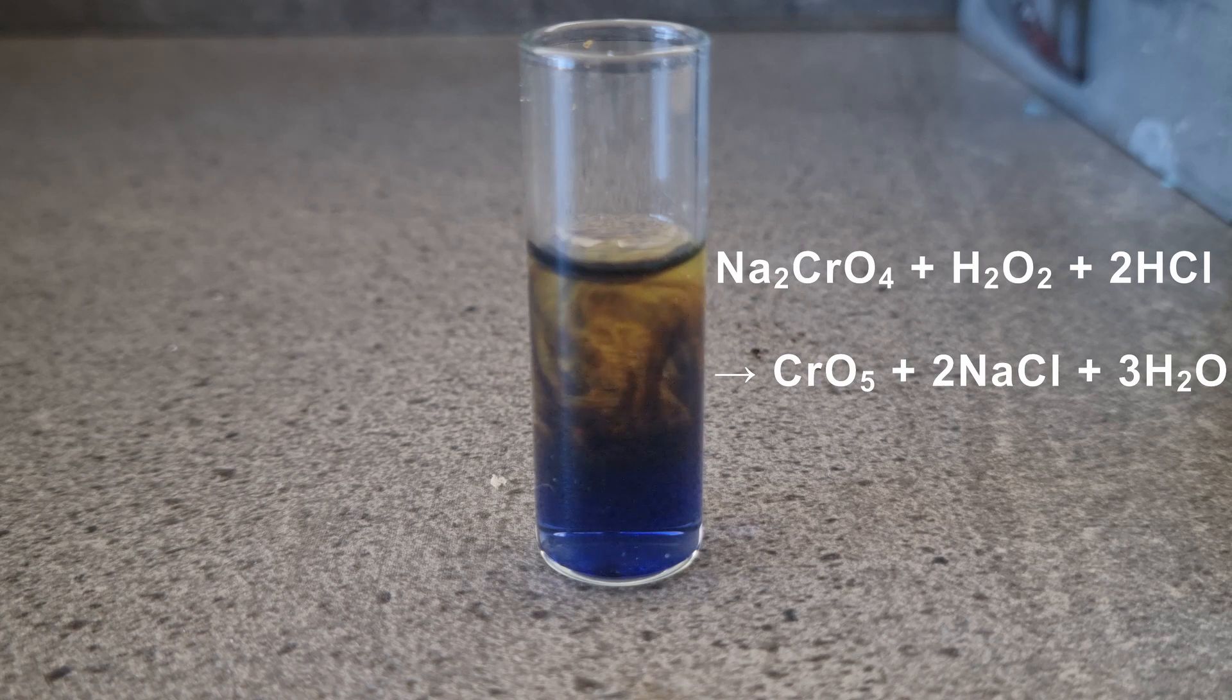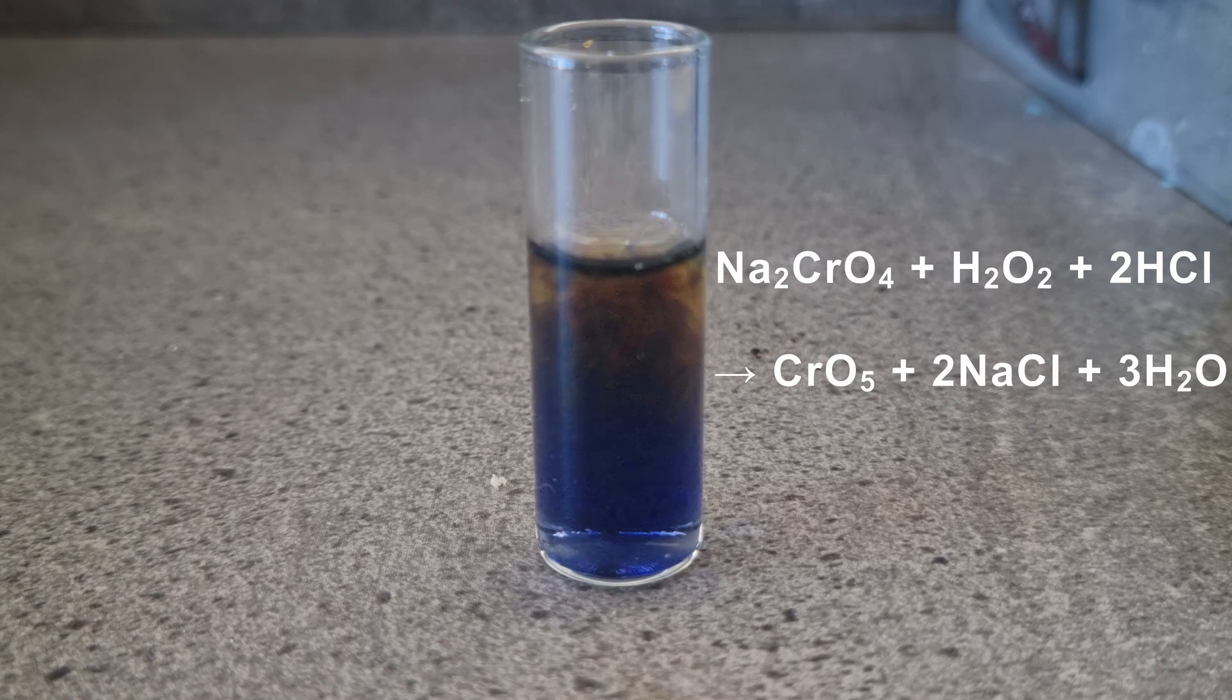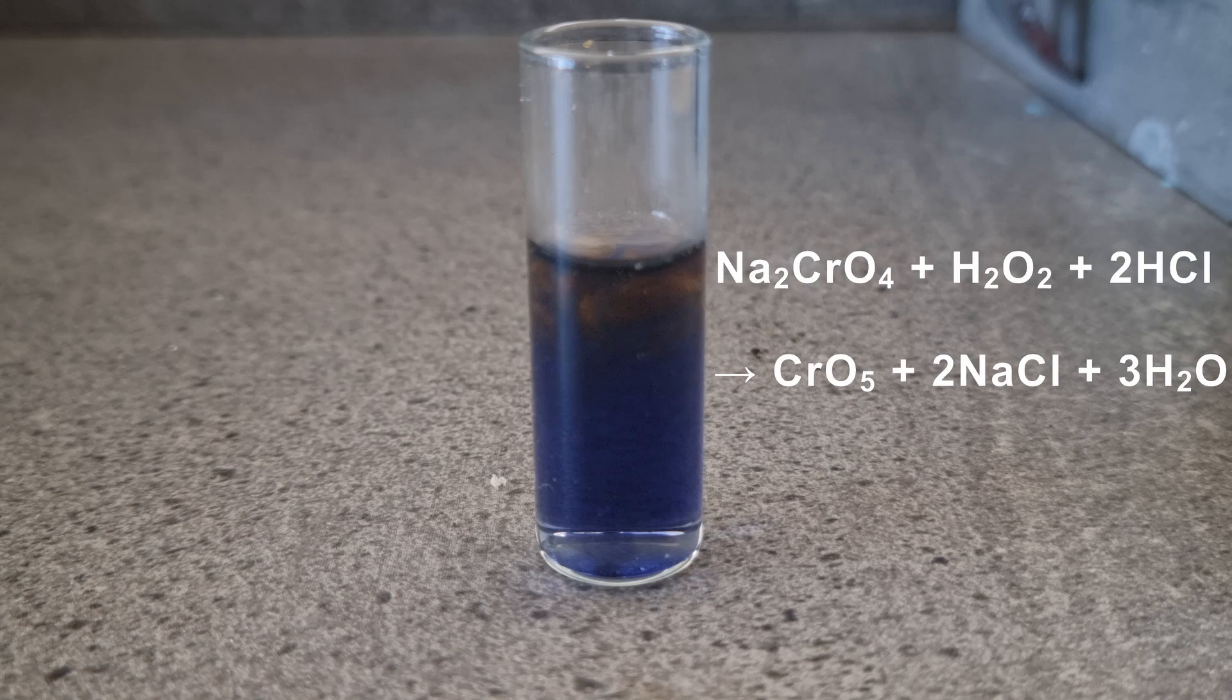This is unmistakably the cursed chromium oxide peroxide complex. The hydrochloric acid provides the necessary protons so the hydrogen peroxide can react with the aqueous chromate ions in solution.